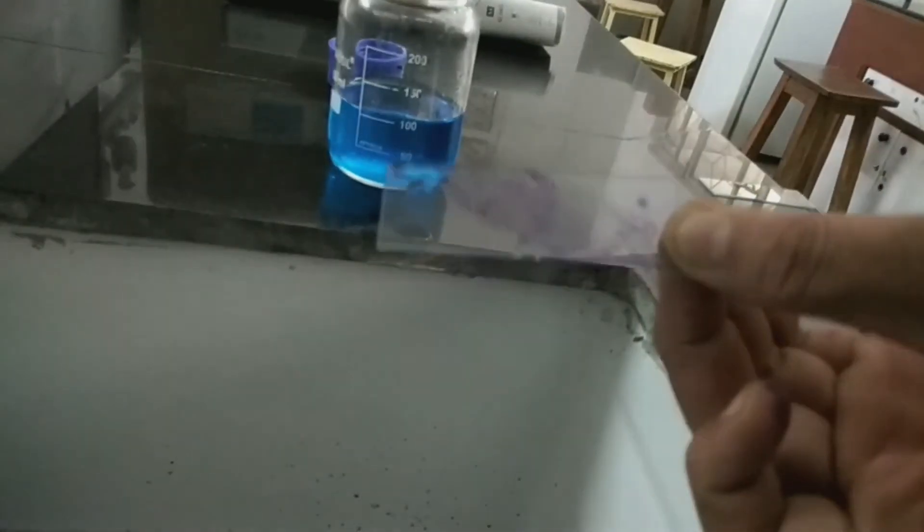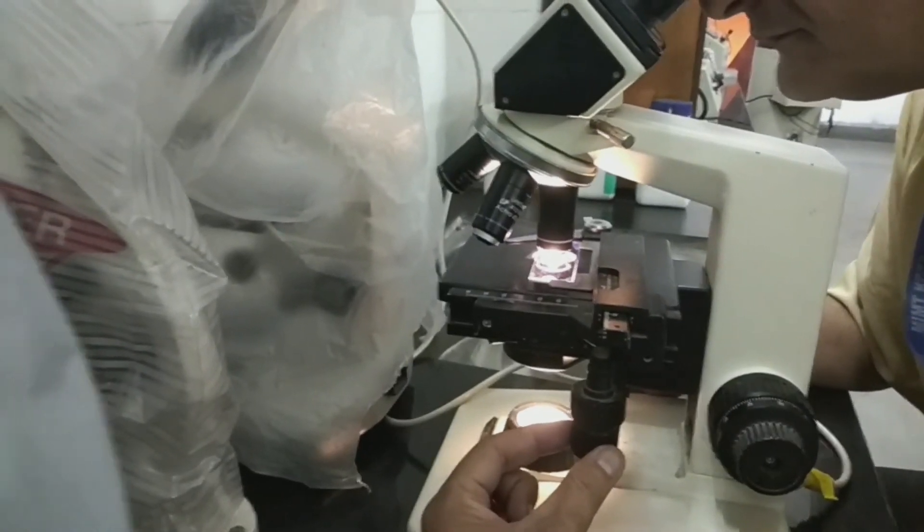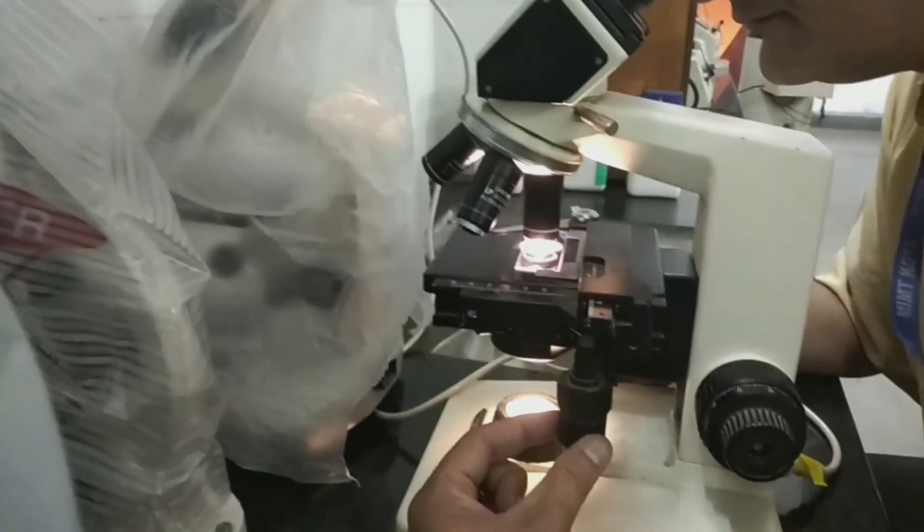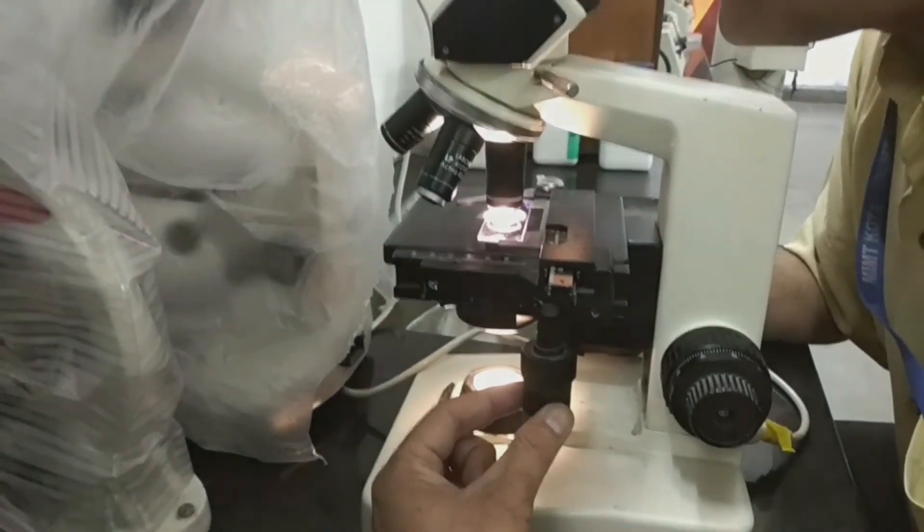After washing, you will see the smear looks like that. After that, you just have to dry the slide and visualize it under microscope under 100x power with oil immersion. You will be able to visualize the bacteria and its capsule.